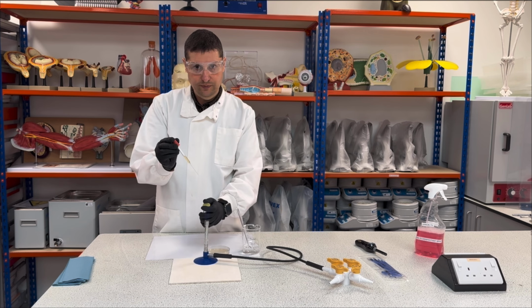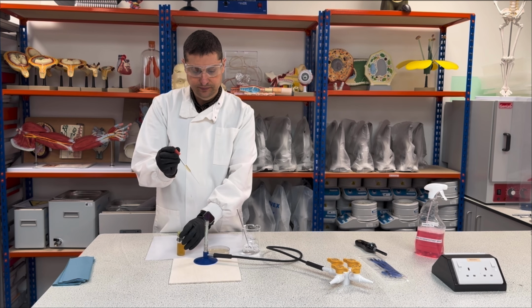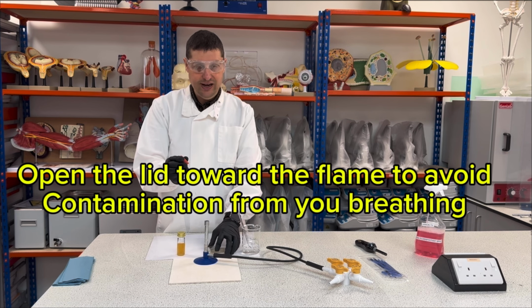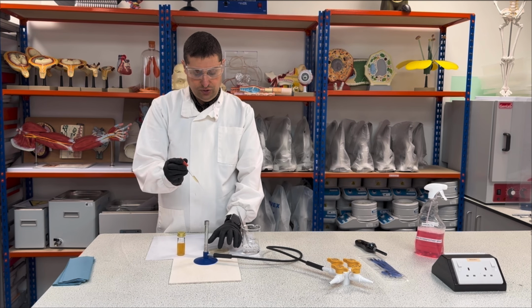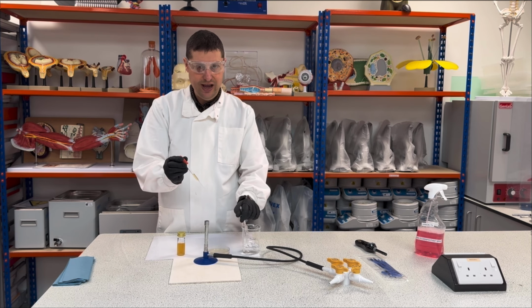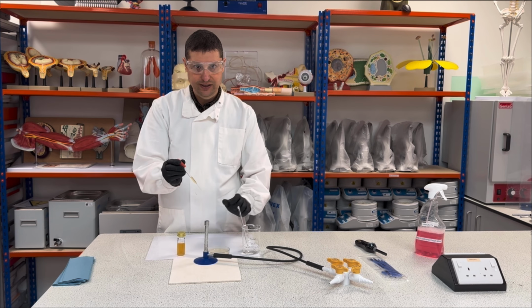Okay, so when the bacteria is collected, I can just close my bottle again. And then I will open my Petri dish and I'm gonna deposit 2 or 3 drops in the middle, and then I will spread with my spreader glass.